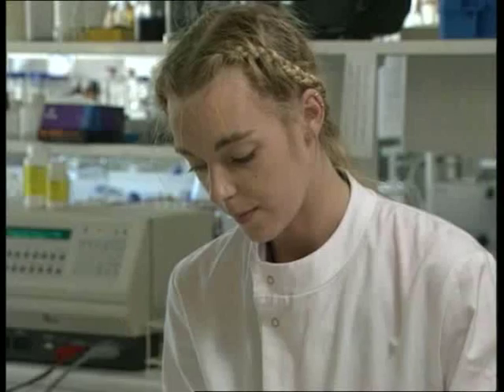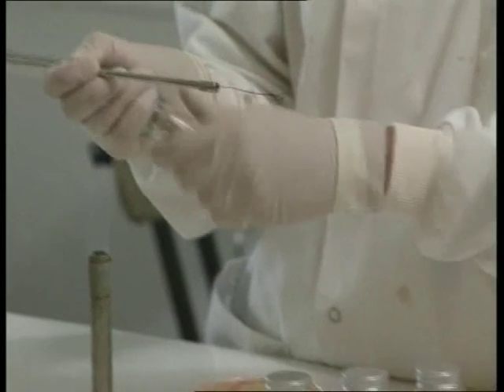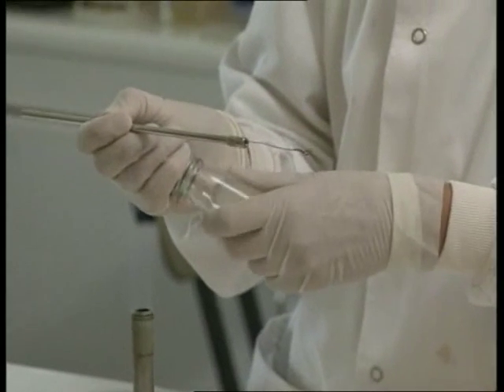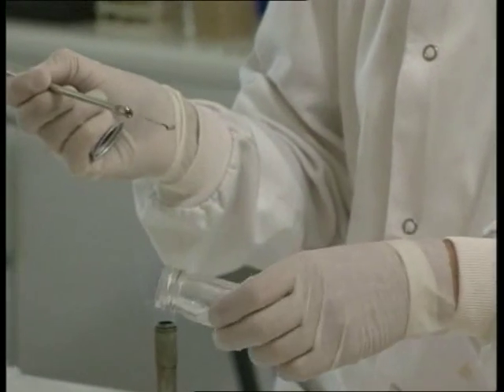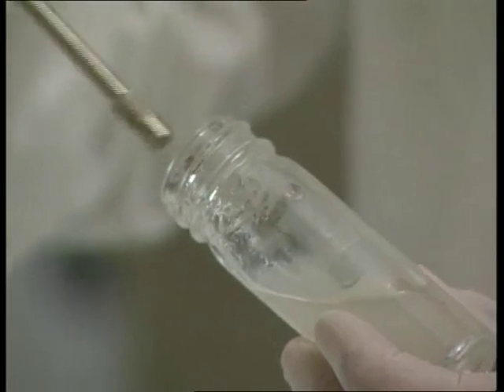but rather a way of working that contains microorganisms within the experiment and keeps others out.